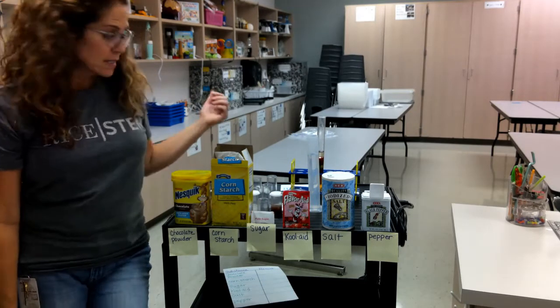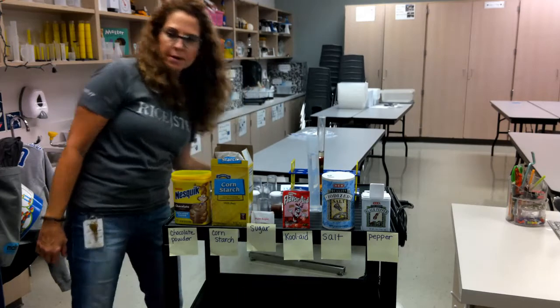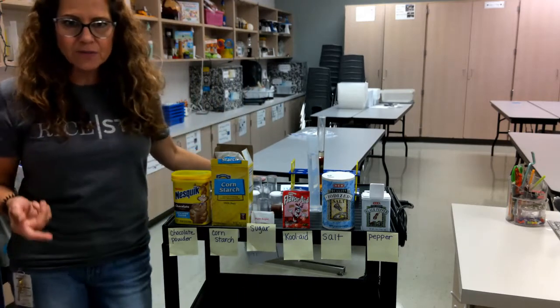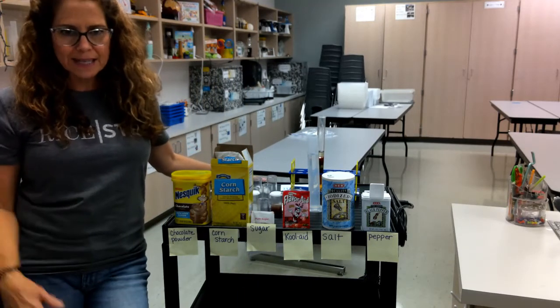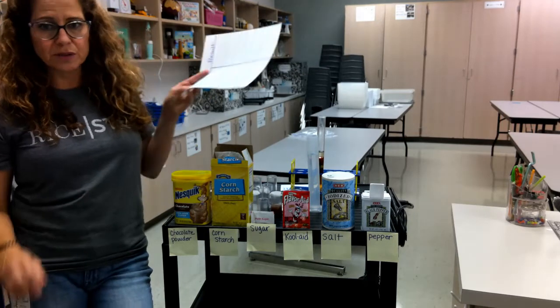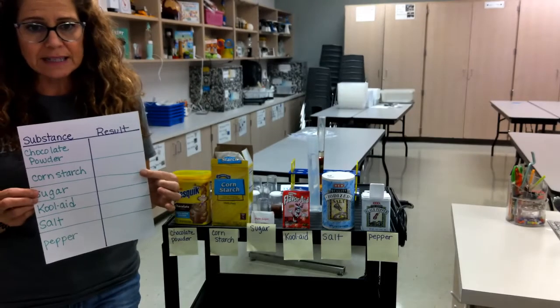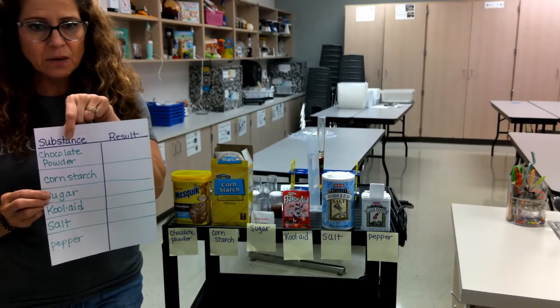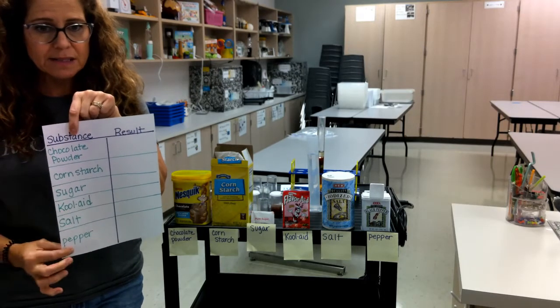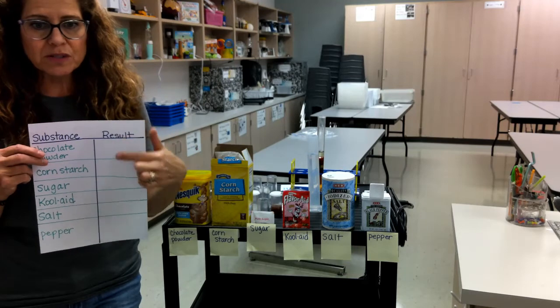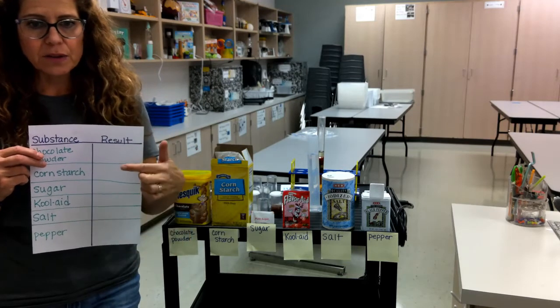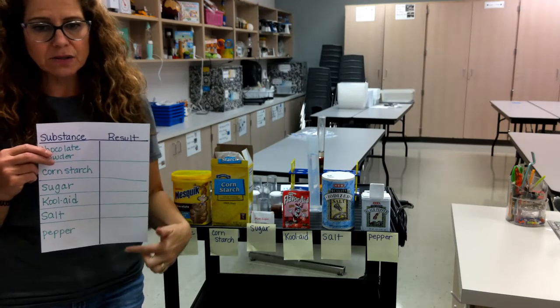And you need to take notes because after this video you're going to go back into Canvas and put the results. So get a piece of paper, you're going to make a chart that looks like this. You're going to put substance on one side, here's our substances, and you're going to put the result on this side. Whether it dissolved or did not dissolve on this side.